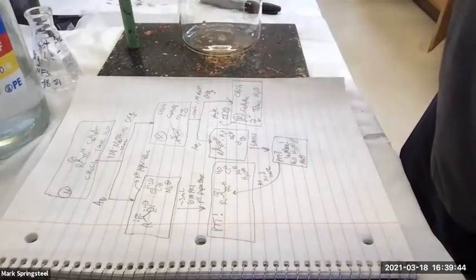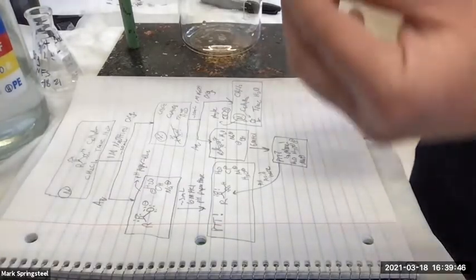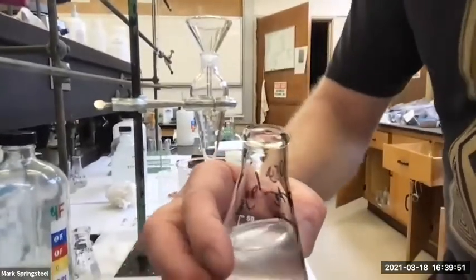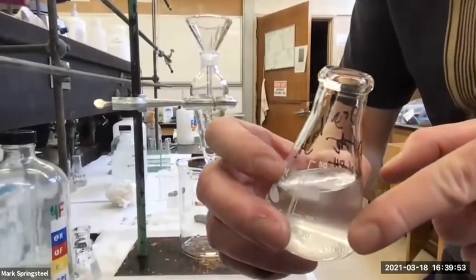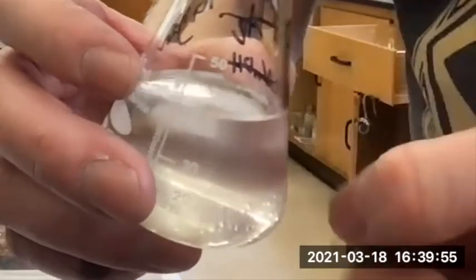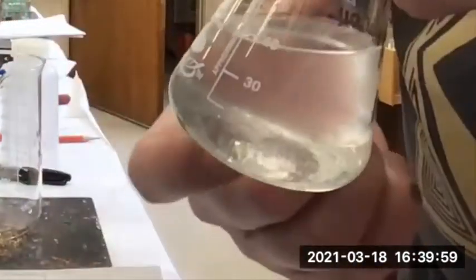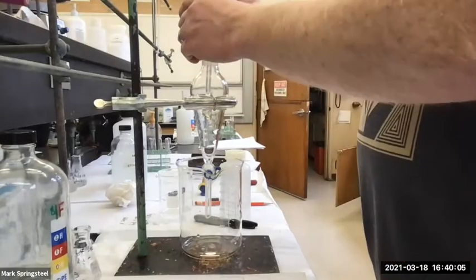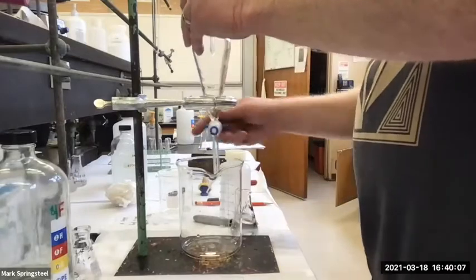I've got my organic layer here. I'm going to put it back in the separatory funnel, and you can see it does have water in it. Can you see the little beads of water in there? Can you see it? On the bottom. It's not because water is more dense, it's just attracted to the polar glass. All right, so let's add that into our separatory funnel. Is it closed? It's closed. We're good.